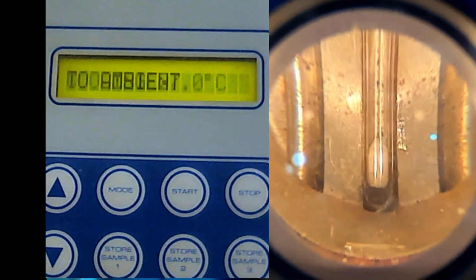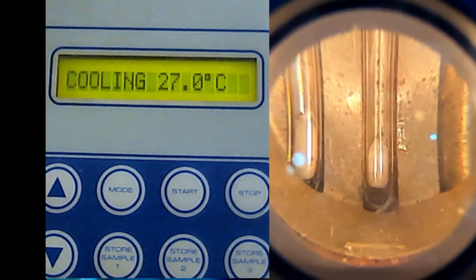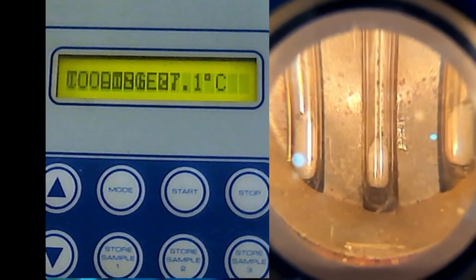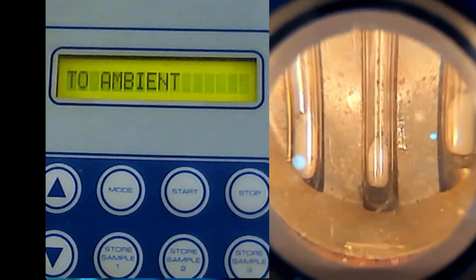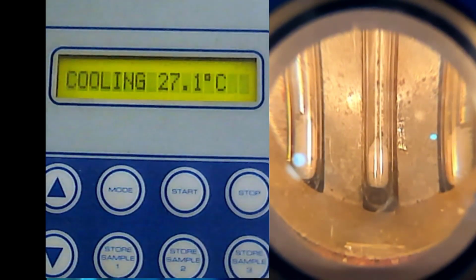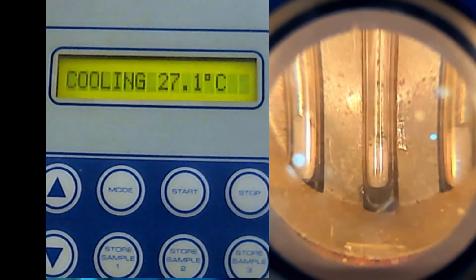I will put one on the left. So you see the sample there, and I put another one to the right. Sometimes you cannot insert this because some of the students broke the glass inside. You need to put it slowly, because if you force the capillary tube inside this hole, sometimes it will break. The glass will break, and when the glass breaks, the technician needs to open the entire thing again. So bear that in mind. That is the precaution.